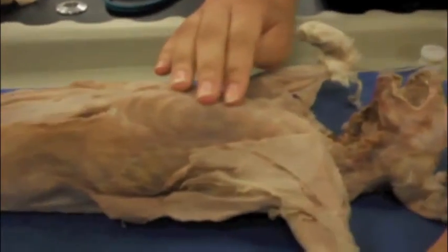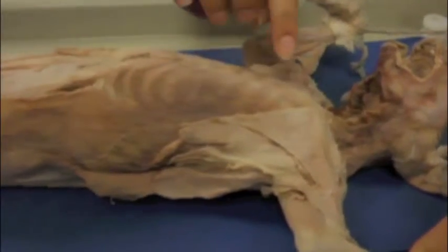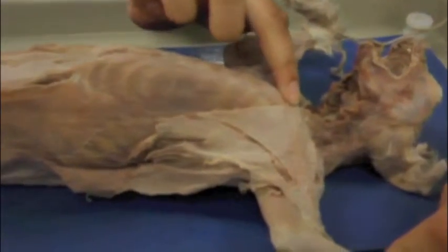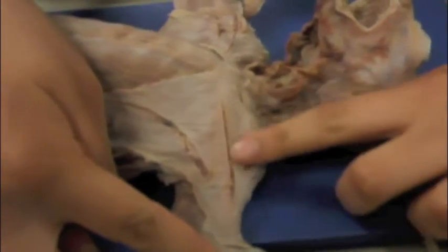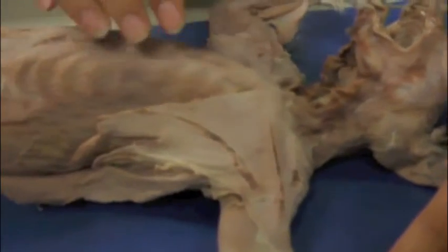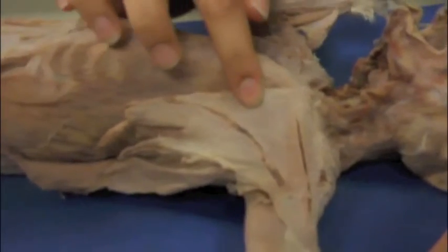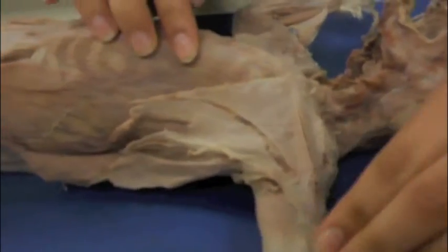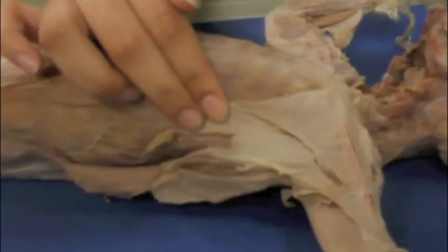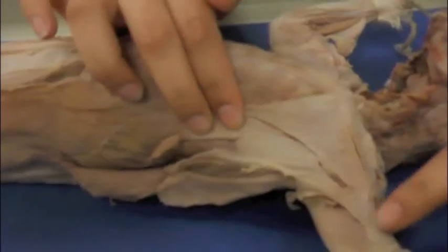The pectoantebrachialis originates in the manubrium, the most anterior part of the sternum, and inserts in the fascia of the ulna, as shown by these cuts here. The pectoralis major originates in the anterior sternum as well, and inserts in the humerus. It is a triangular flap. The pectoralis minor, under it, originates in the mid to posterior part of the sternum and inserts in the humerus.